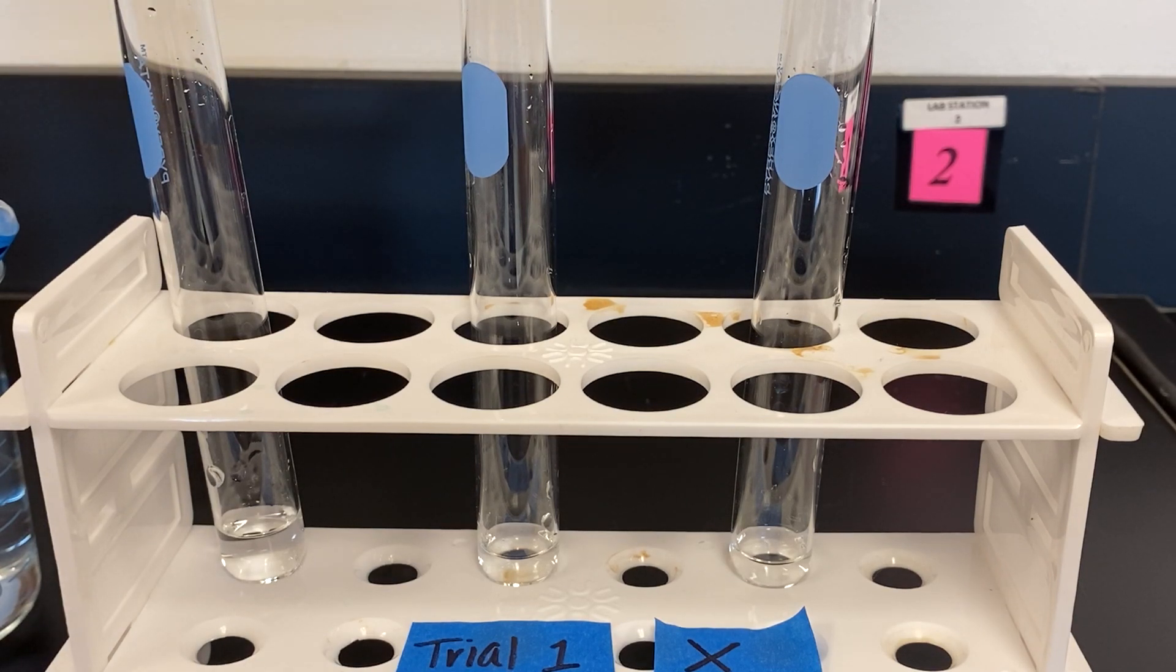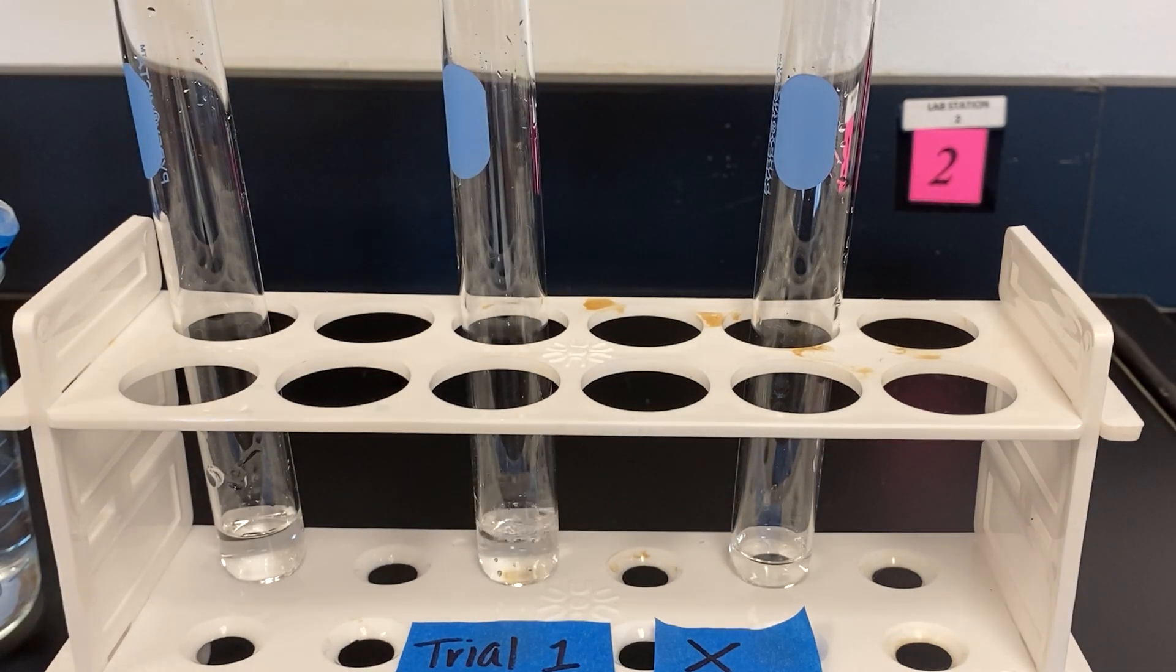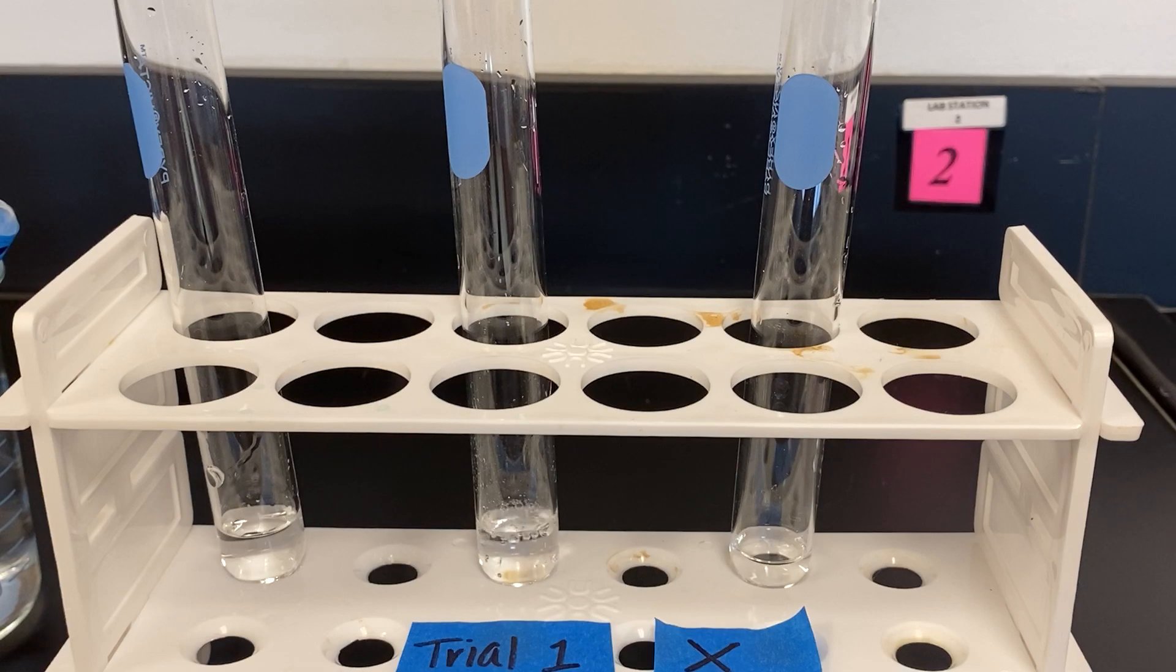We are going to add Y to the second tube, which makes the combination X, Y, and as you can see there is bubbling and fizzing.